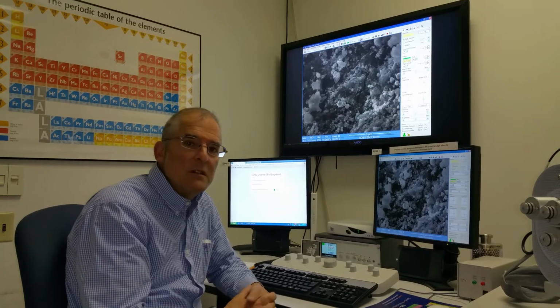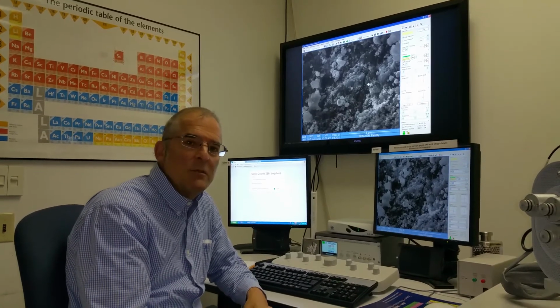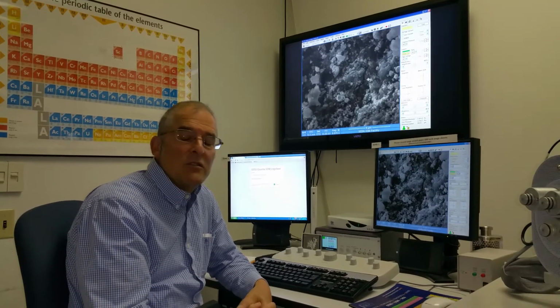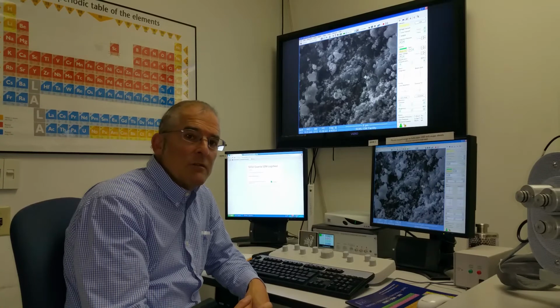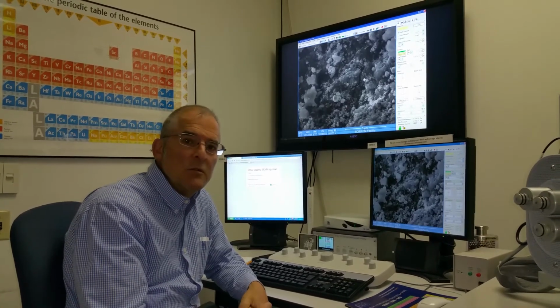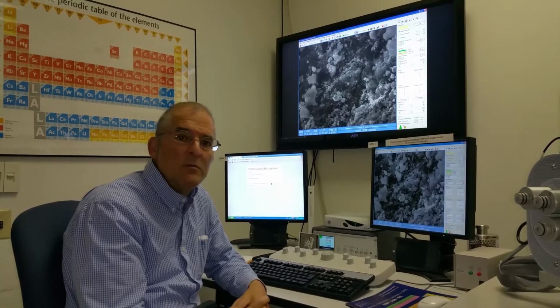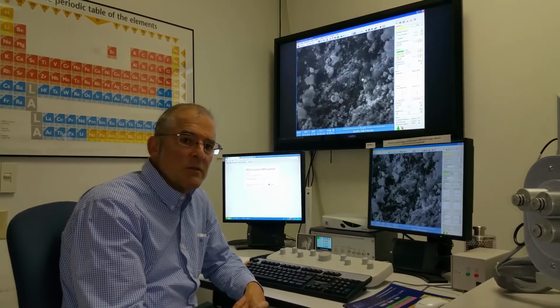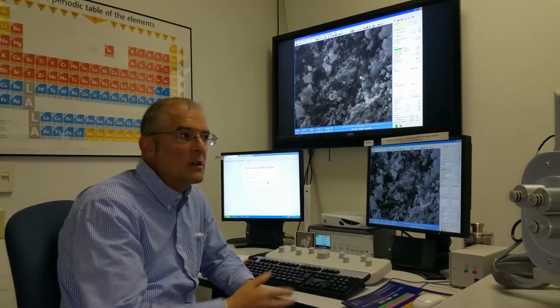That gives the students an opportunity to see what it's like to be a scientist in our particular field. Obviously in the biology department, so I'm describing students' experiences as they would be in the biology department. But all the different departments on campus engage in research of one kind or another. You have people in the English department who will be looking at text and creative writing, etc. But in the sciences, we're looking oftentimes with this high-end equipment like this.